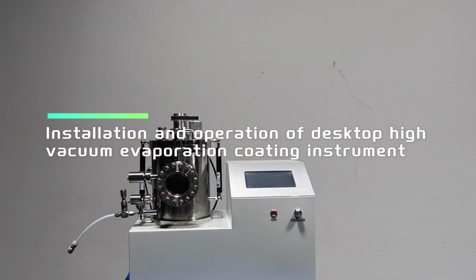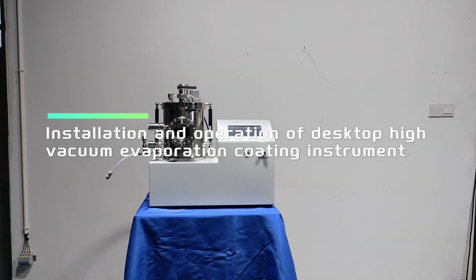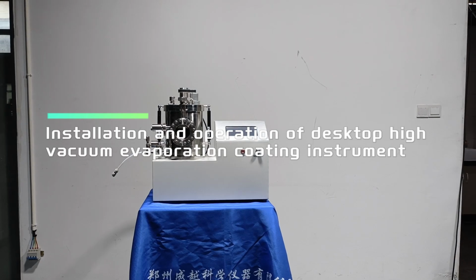Installation and operation of a desktop high vacuum evaporation coating instrument.